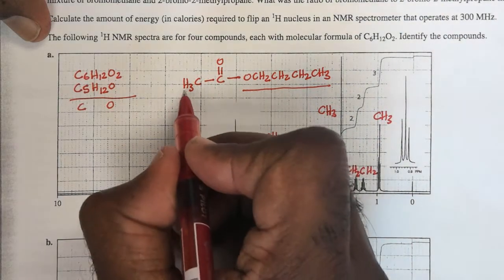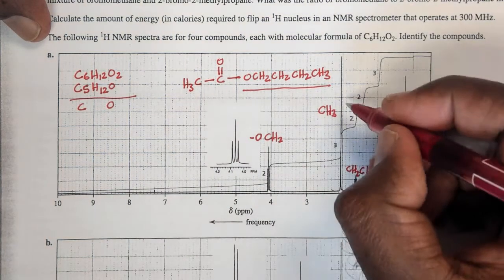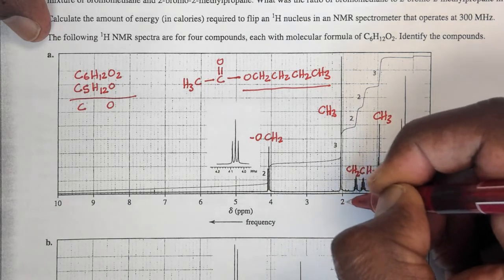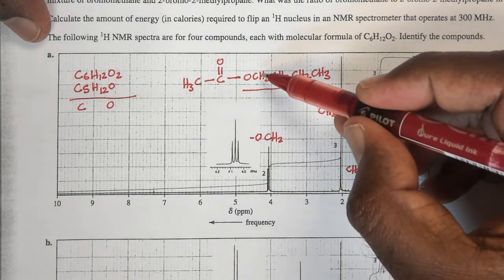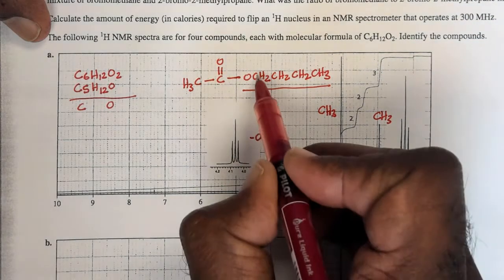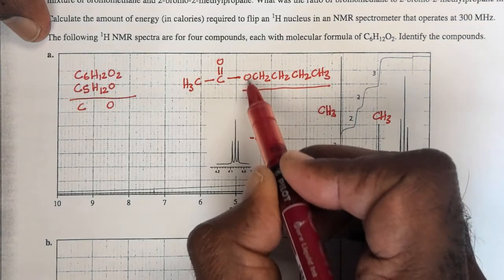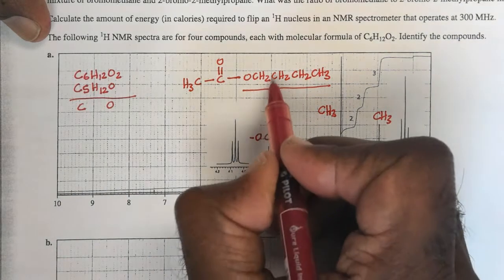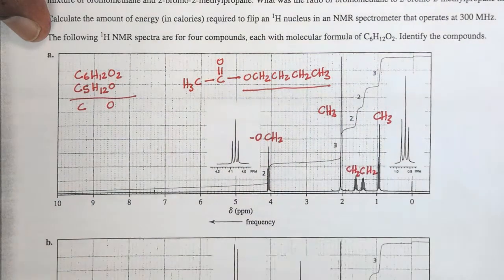Just to make sense of it again, the CH3 is a singlet. It's not joined to any protonated group. That's why I see it as a 3-proton singlet here. The chemical shift is around 2, and that's because it's next to this carbonyl group. I get 2 triplets, one for the CH2, one for the CH3. I can see the 2 triplets here. The CH2 triplet is much more deshielded than the CH3 triplet because of the electronegative oxygen atom. So I have 2 multiplet CH2 groups for the inner methylene groups, and everything makes sense in this particular structure.